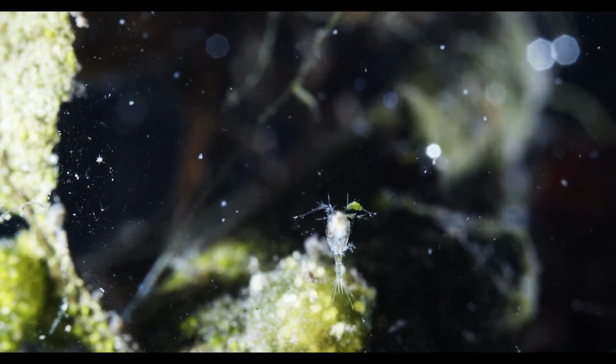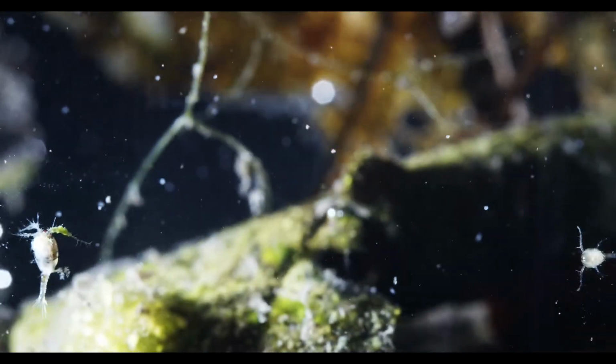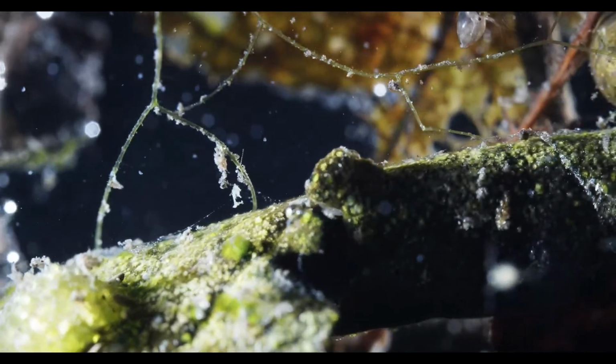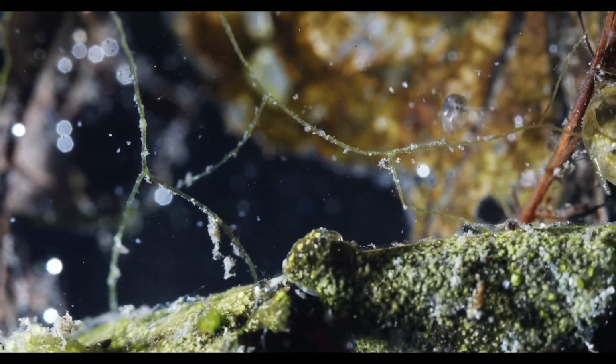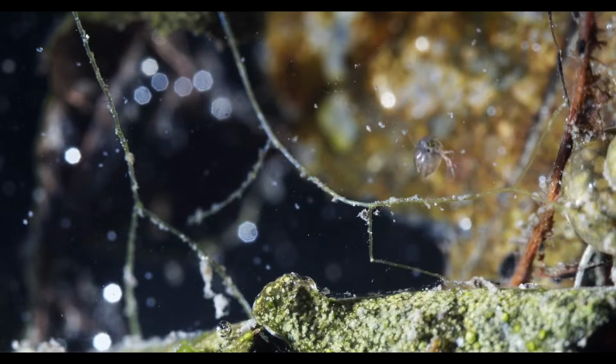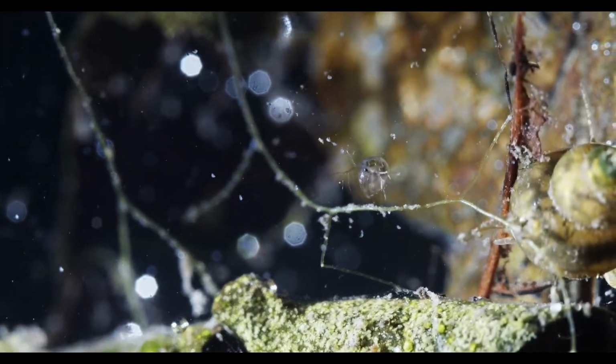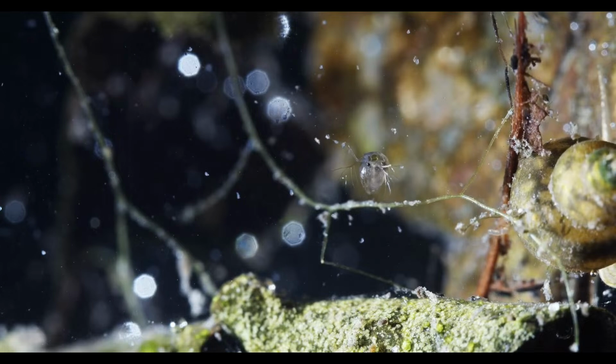I mean, the whole resurrection jar system and all is great, but to be honest, personally, I think 30 days is kind of... It will be hard to identify the things that are in there.